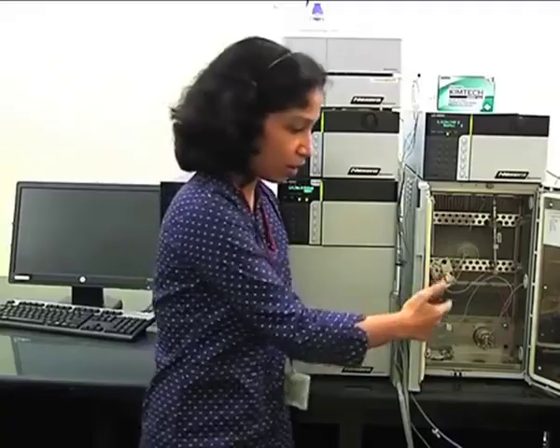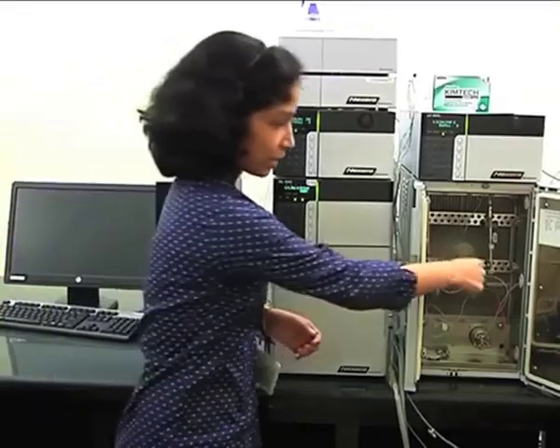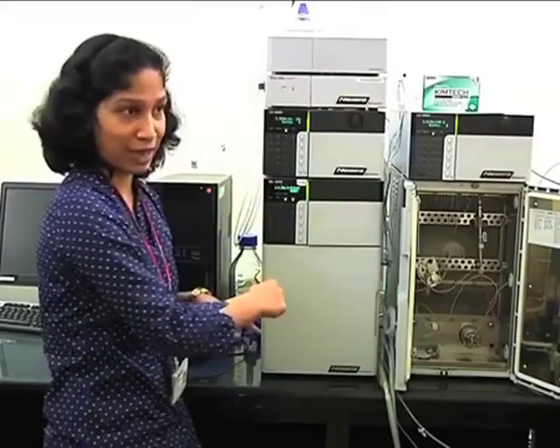Okay. There are different types of mixer available, 20 microliter, 40 microliter, 180 microliter. So depending upon your requirement, you can select which mixer is good for your analysis. Of course, the higher the volume, the better will be the mixing, but the system volume increases, so your peaks will come slightly late. So you will have to strike a balance whether you want to finish your analysis very fast or you want better mixing. Depending upon that, you will be selecting your mixer. So after the mixer, your flow will go to the auto sampler.